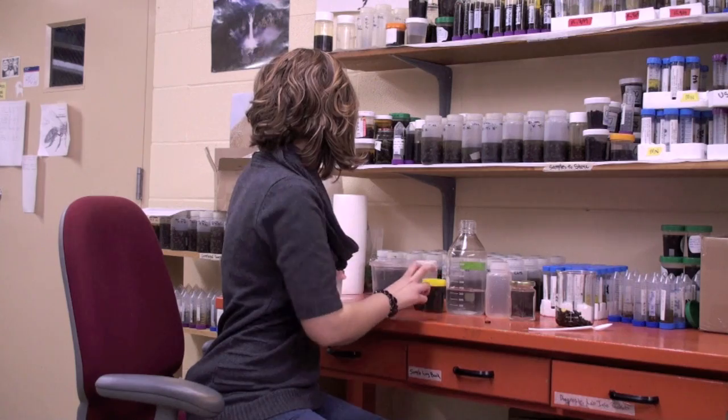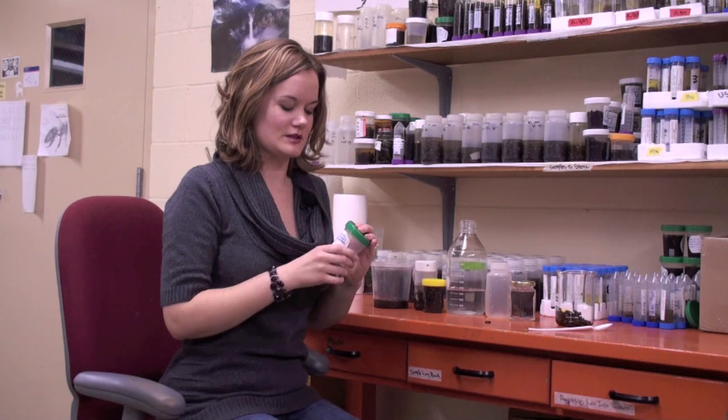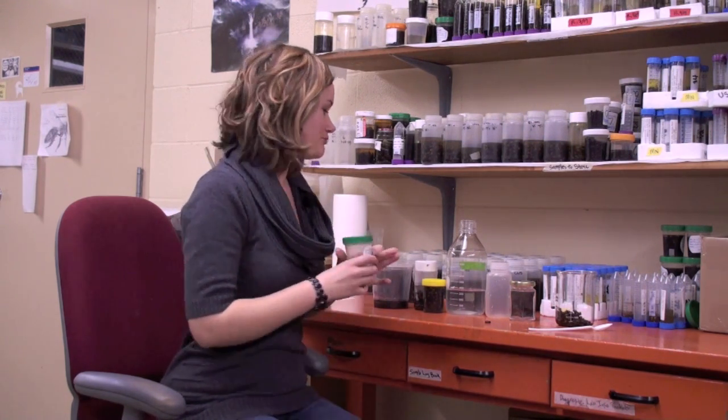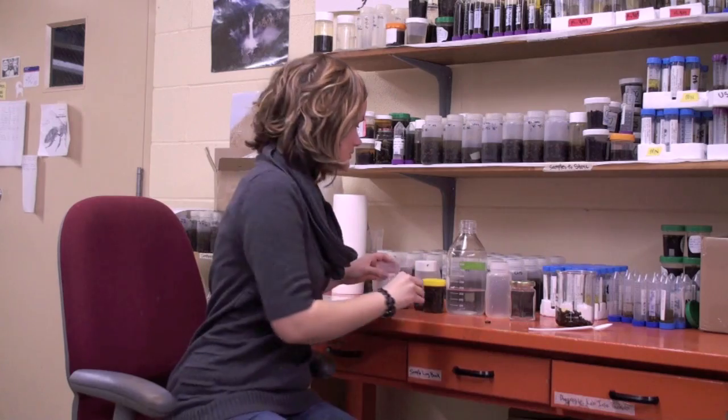You can also use a urine sample bottle — these are actually really good and you can get them for 50 cents at your local pharmacy. They usually have a tape sticker on the outside where you can write the date that you sampled (not the date you're sending it, but the date it was actually sampled), the colony number, and your name. On the lid, put the colony number. Then take a little piece of paper, use a pencil, and write your initials and the colony number on it — stick it inside with the submerged alcohol. That way I have all the information I need when you send me your sample.